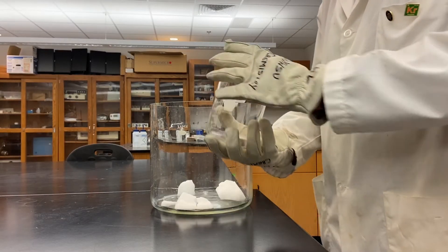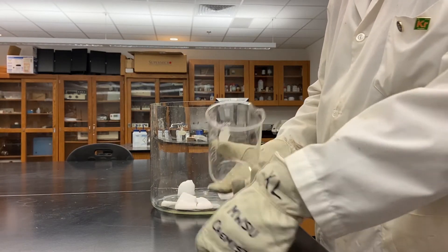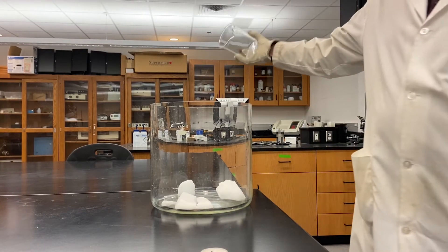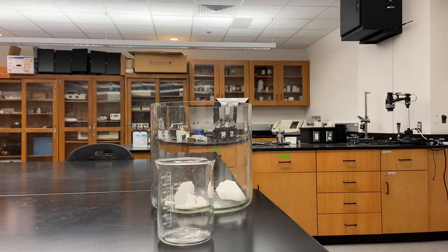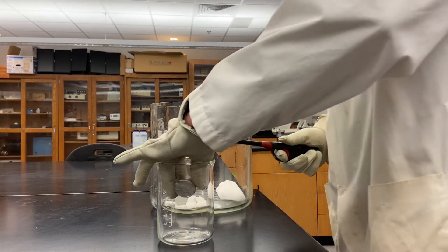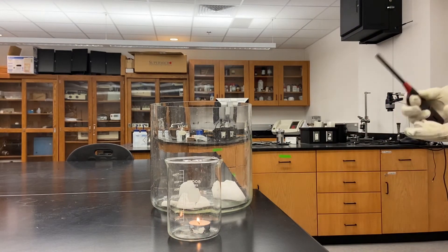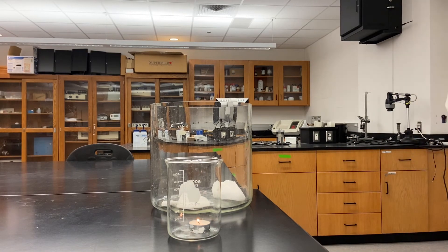I'm going to give you another example of the pourability of carbon dioxide. We have to empty our beaker out here and refill it with air. I'm going to put my candle back inside and relight it. Of course that candle won't burn unless there's air in there, so we can see that yes, I've dumped that carbon dioxide out.